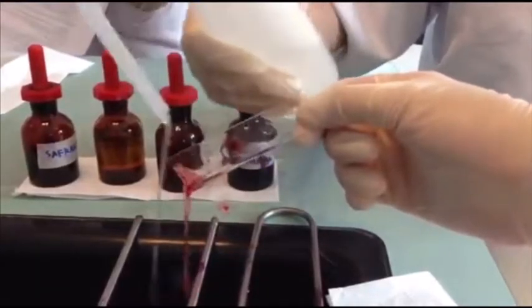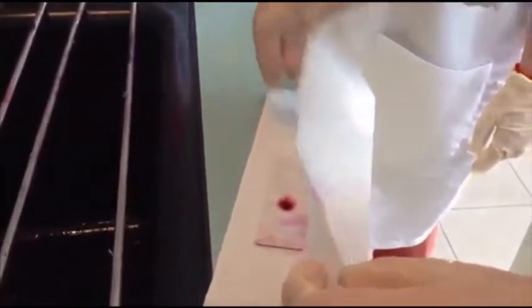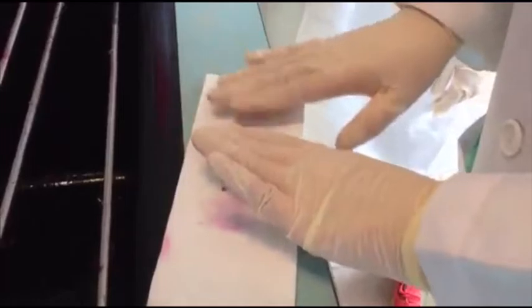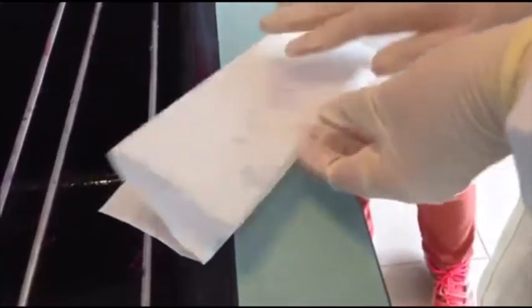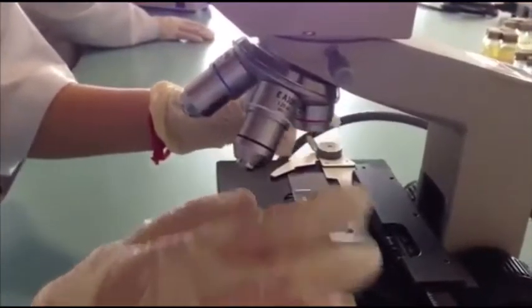We use the gram staining method in order to identify whether the bacteria from the sample is positive or negative. Finally, blot it dry with paper towels. First, we have to clean the slide, and then add 1 drop of distilled water onto the slide. After the gram staining, we will put a drop of the immersion oil on the glass slide and view it under the microscope.